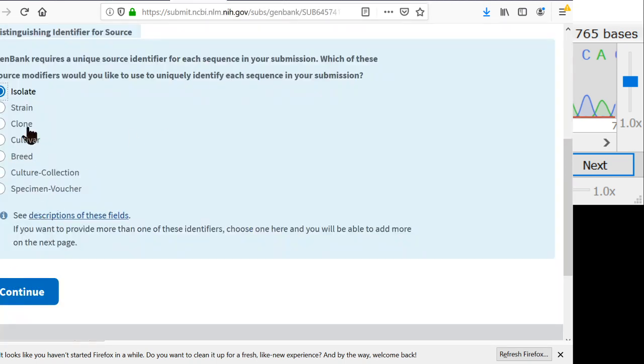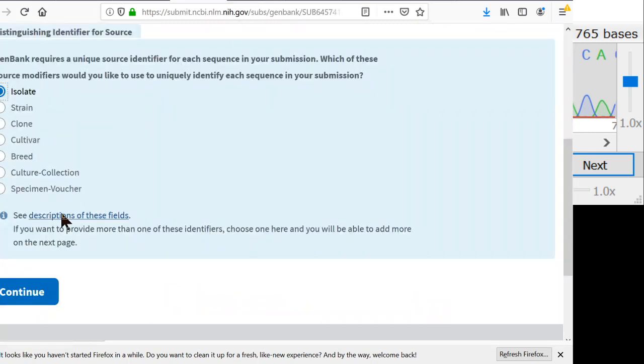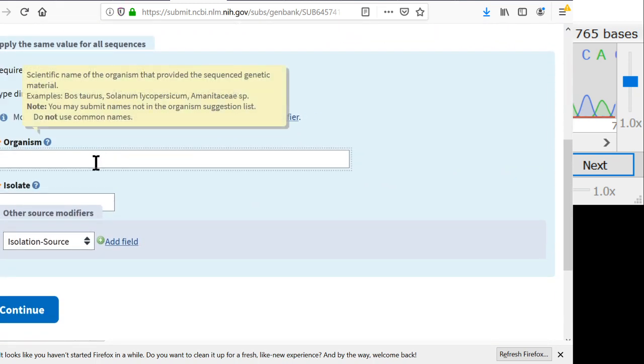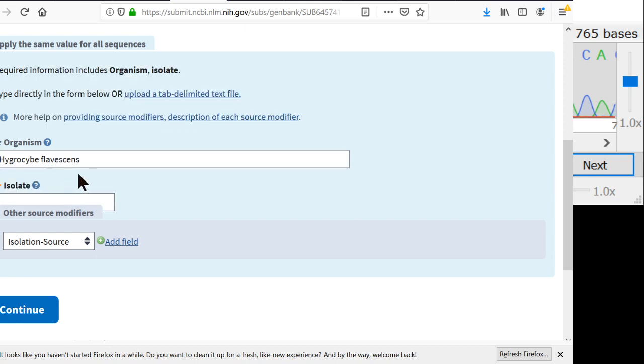So back over here, our required field will be isolate. And I'll just copy that to the clipboard. And so now we can put in here's what's required. So definitely the most important thing, or a super important thing, is the organism. And if you don't know what organism you have, that's fine. You can just put in like fungi or some higher level classification. But I know this is Hygrocybe flavescens, so that's what I'm going to do.